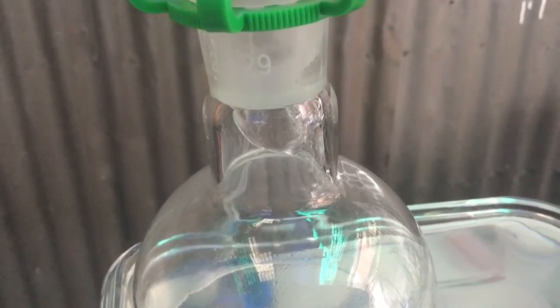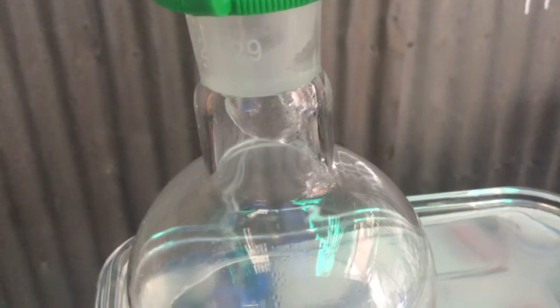After a while we got a steady rate of distillate coming over. The distillation was then allowed to run for about 4 hours.